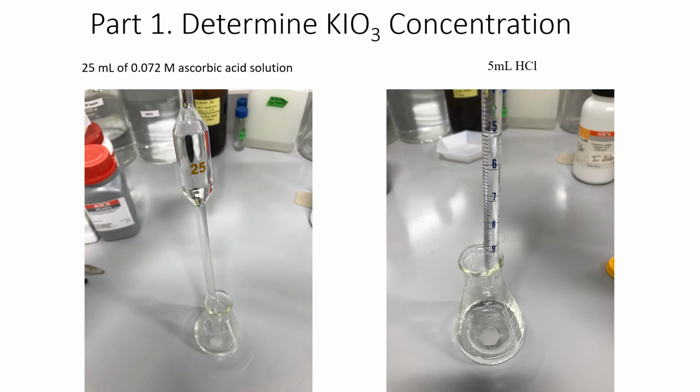So first, I pipette 25 milliliters of this standard ascorbic acid solution with a concentration of 0.072 molar. Right, so if I have the concentration and I have the volume, I can calculate the number of moles of this ascorbic acid added into the flask. Because it requires acidic condition, I add about 5 milliliters of this hydrochloric acid.